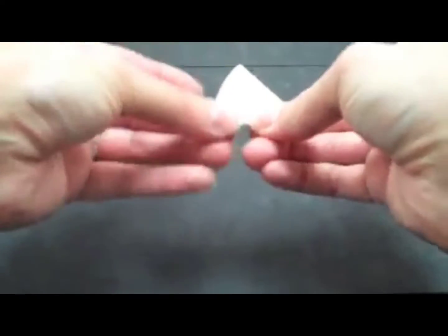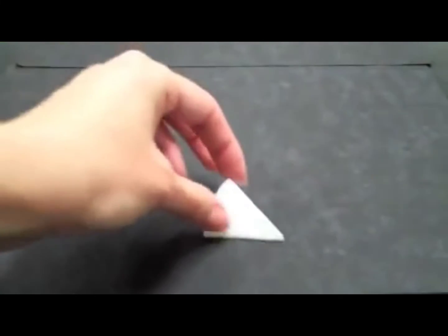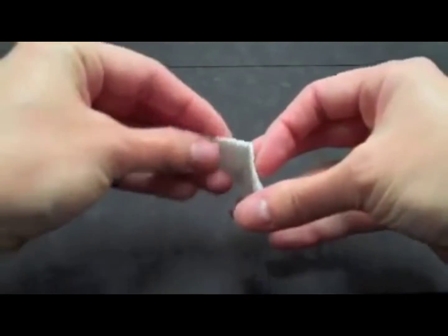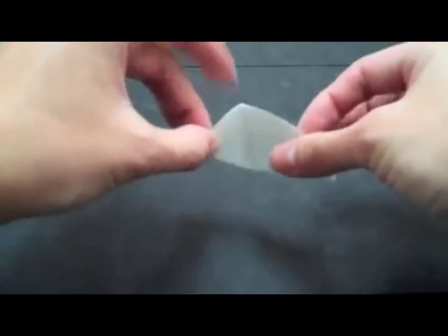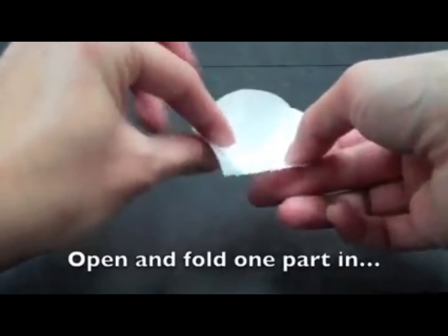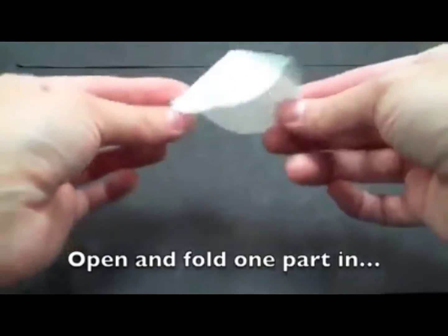And again. Next, open and fold one part. And that's it.